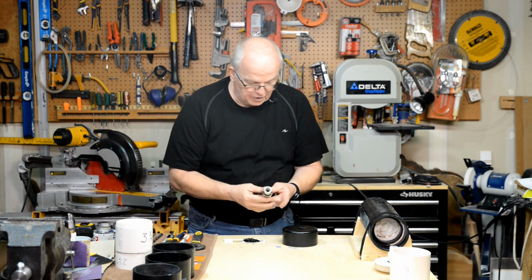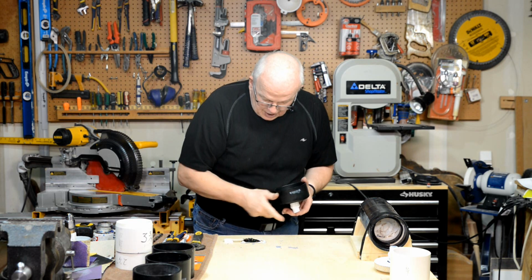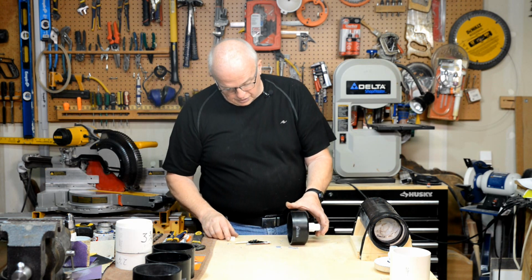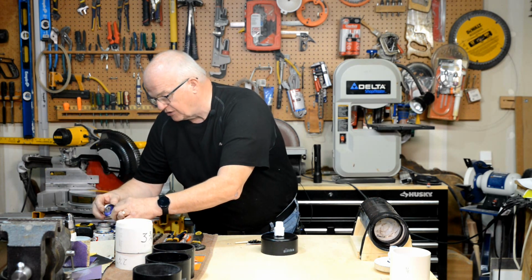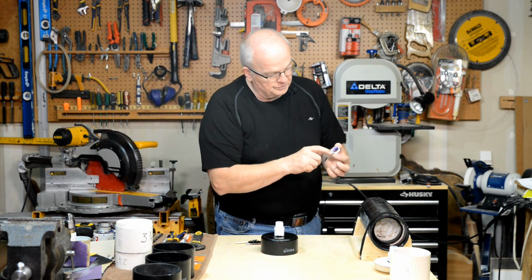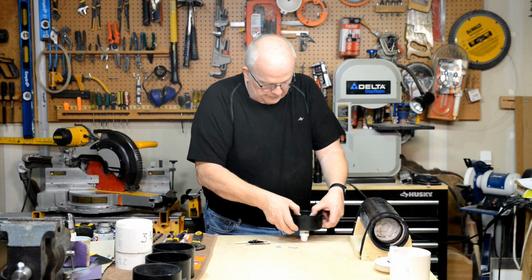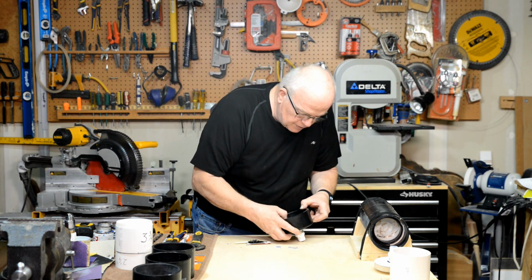Now this is beginning to set up, so very quickly push this down into there, twisting it a little bit, and by golly, I've got a good seal. Now this one has got enough goop around, or epoxy around the edge. I'm not going to go ahead and put any glue on it, but I will prime this a little bit, just to soften it up. And there's so much around that inside edge. Now remember, the one that you want down is the edge that represents this outside edge here. Okay? So turn it over, push that epoxy down, push that ring down onto there. And there, oh, there's lots of squeeze out all the way around it. Excellent.